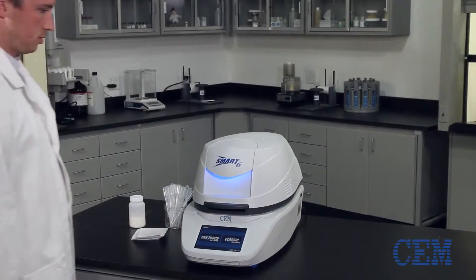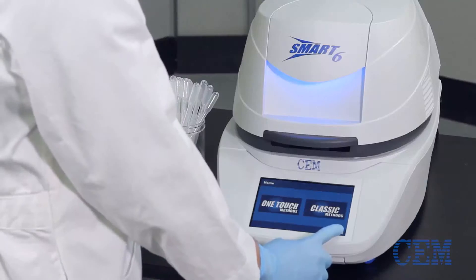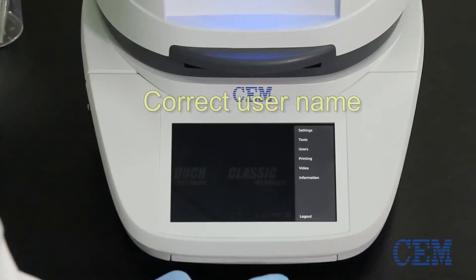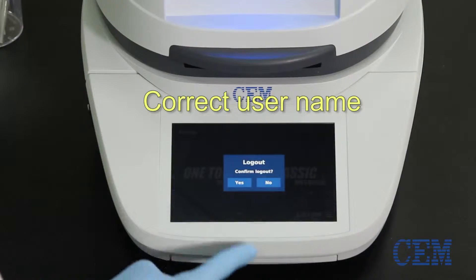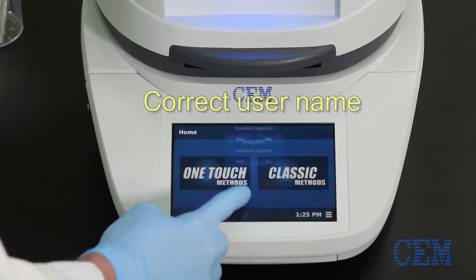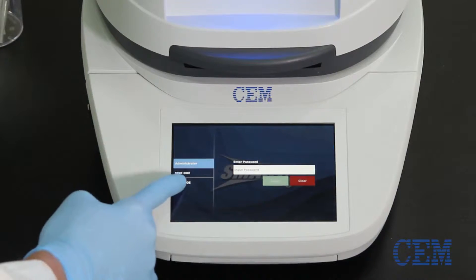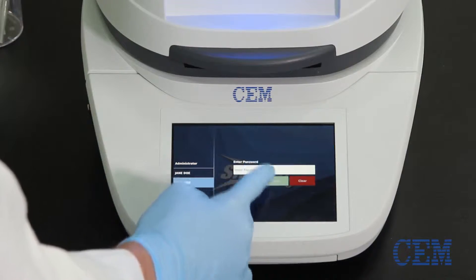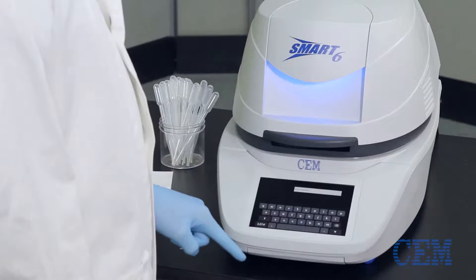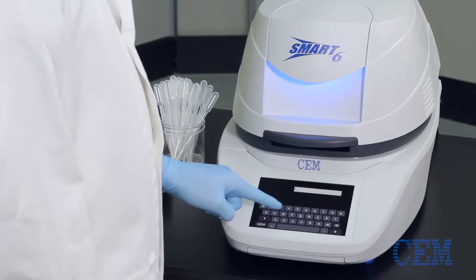Before analyzing a sample, make sure you're logged in under the correct username. Every individual technician can have their own password-protected user login to ensure better data management and improved organization for audit trails.